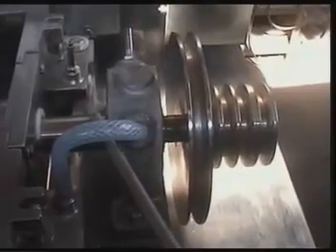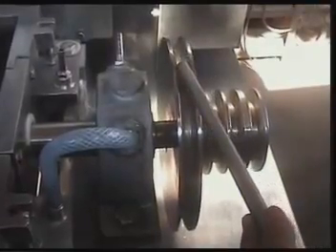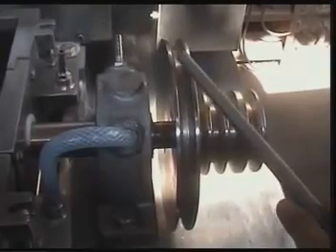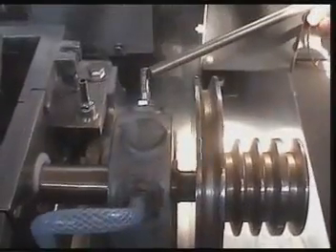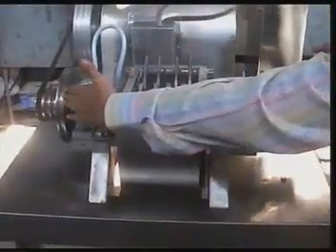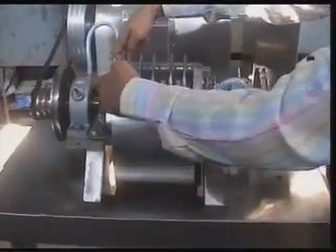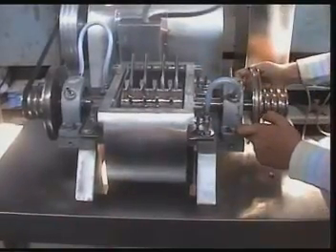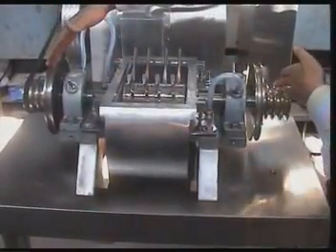This is pillow block number two, and this is the pulley which remains idle when the machine is running, but it is helpful when we change the position of these beaters from knife to impact. You don't need to change the pulley — you have to simply rotate the whole assembly.